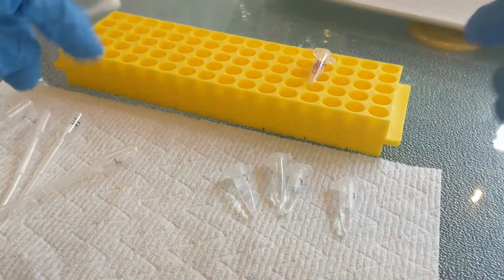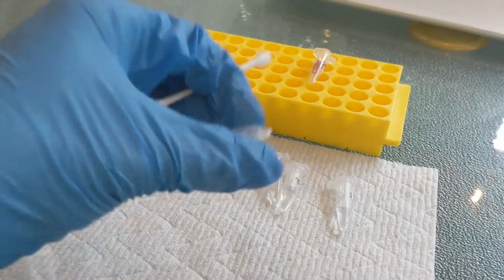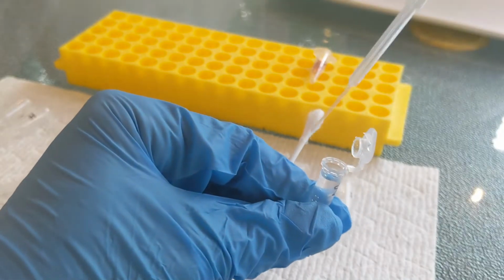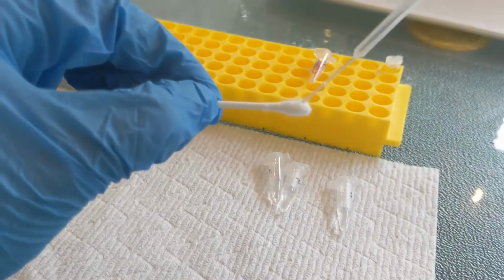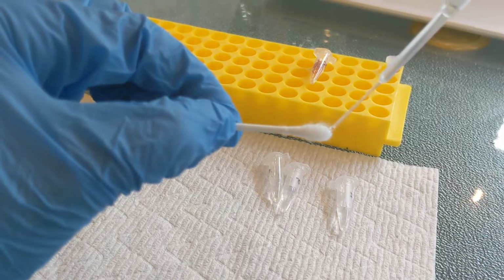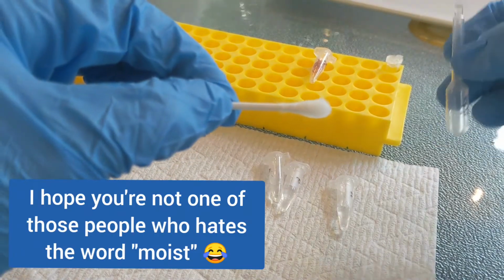Okay, so the first thing you're going to do is just moisten the end of your swab with some water. So we want to use the transfer pipette that says W for water, and then the tube that says W for water. And it doesn't matter exactly how much you use, just put some in your pipette and add drops until the end of the swab is nice and moist. The idea is that it's going to be able to pick up your blood sample.